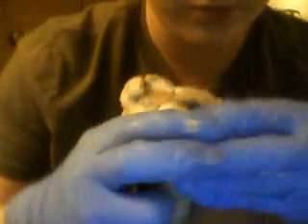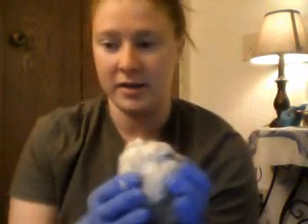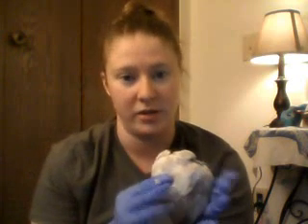You can see it on both sides. And you notice that on this left side, it's a lot thicker. The left side myocardium of the ventricle is a lot thicker because the left ventricle has to pump blood to the entire body, whereas the right side only has to pump blood to the lungs.